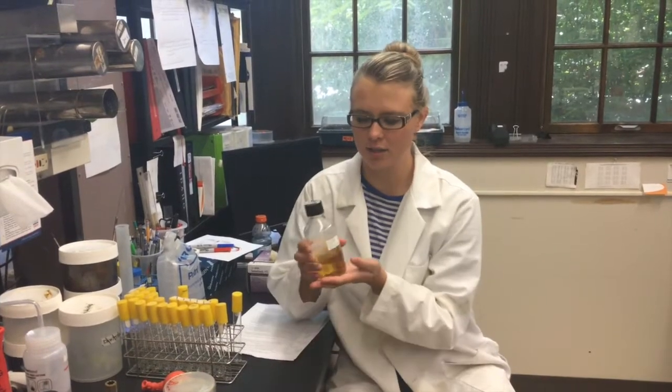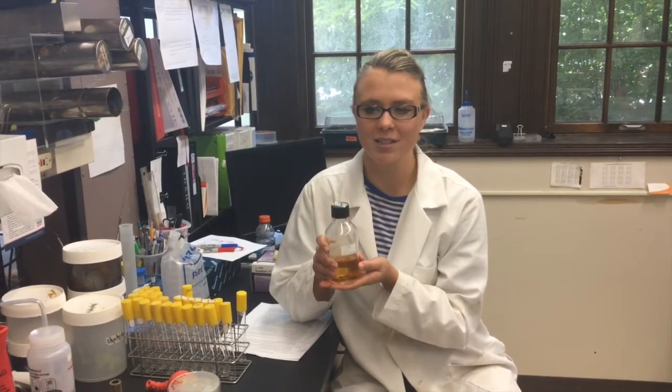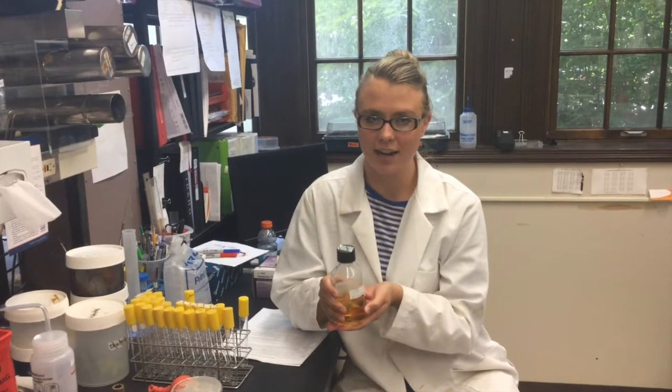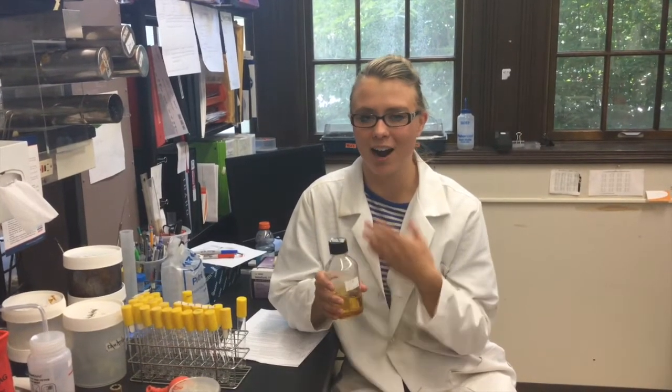Aseptic techniques keeps apparatuses and solutions sterile. If I use this bottle of LB, but somehow contaminate it, when you then go and use it again, it's therefore contaminated from when I used it.